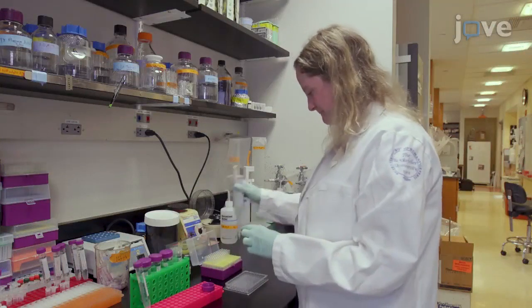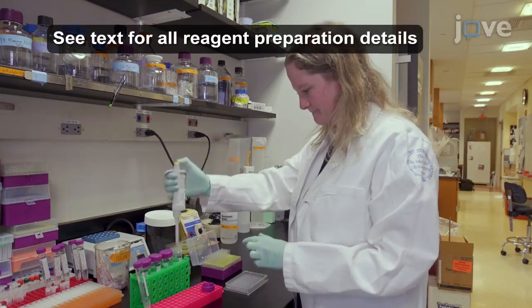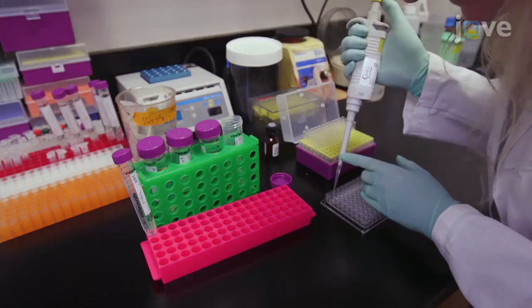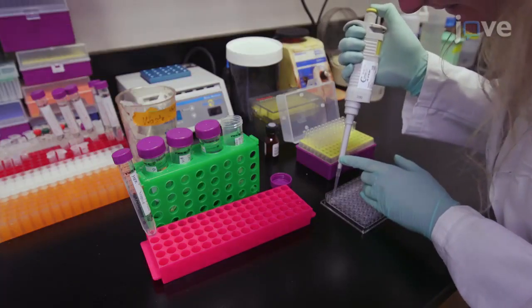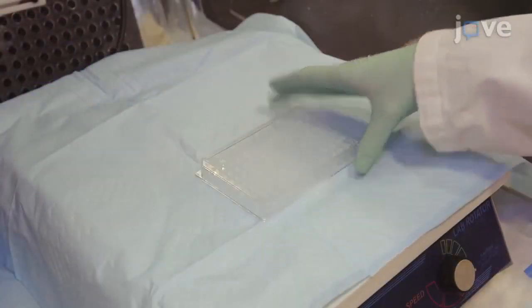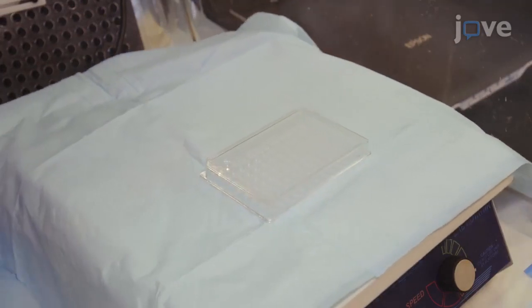Begin by adding 1.5 micromolar of freshly prepared fibrinogen in 200 microliters of clot formation buffer to each A-beta-42 containing and control wells, and incubate the plate on a rotating platform at room temperature.